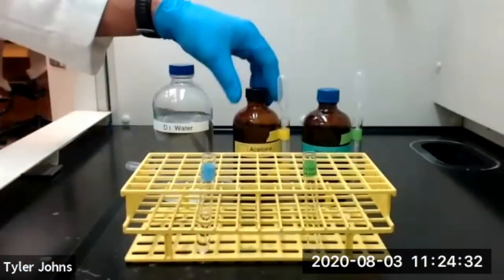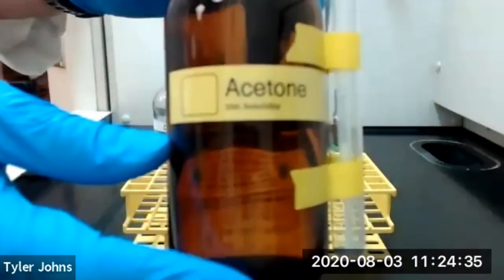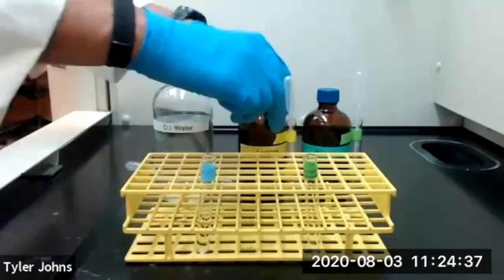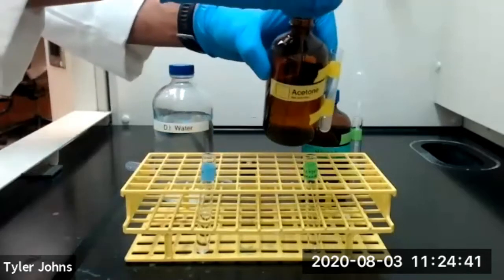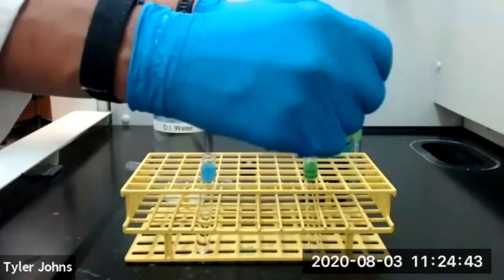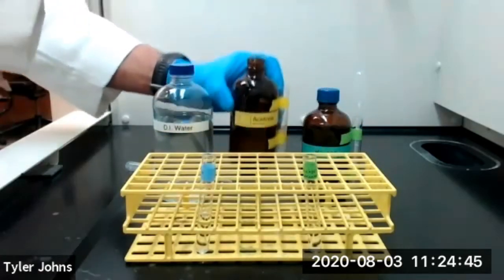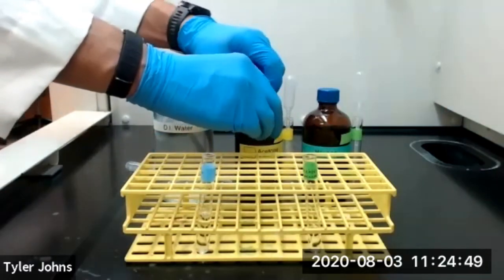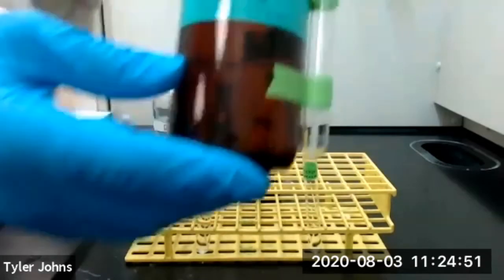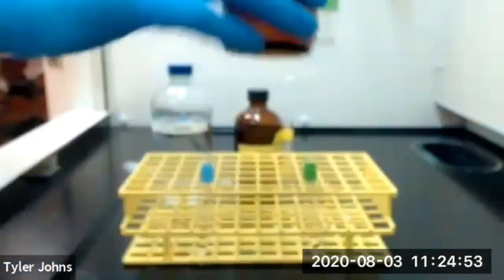We're next going to add 2 milliliters of acetone to our second test tube. And we're also going to add 2 milliliters of hexane to our second test tube.